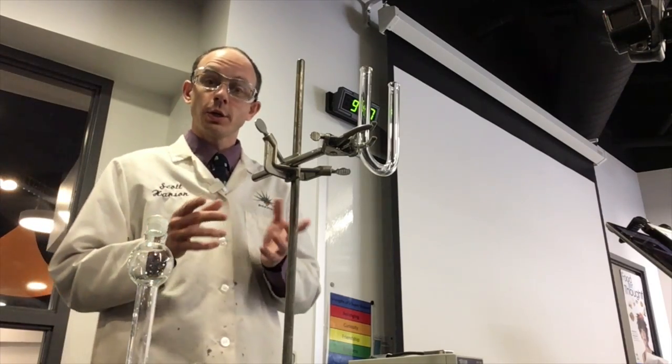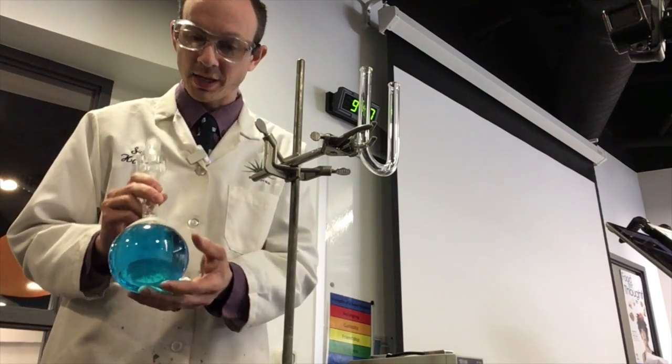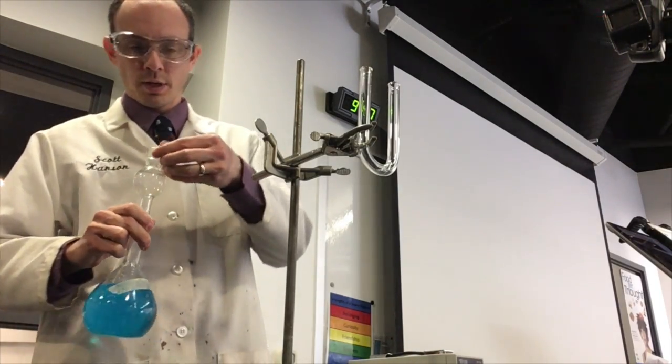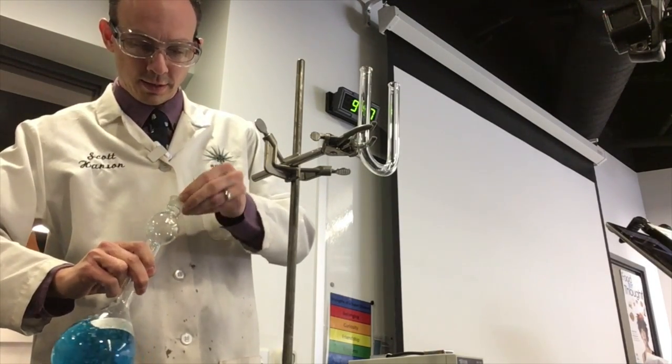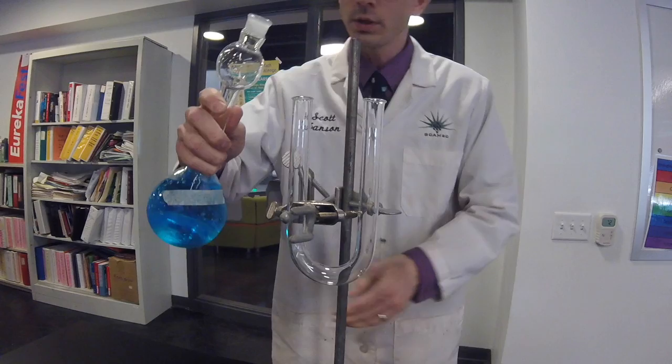So here's what we're going to do. We're going to take this copper chloride solution and I'm going to pour it into the U-tube.